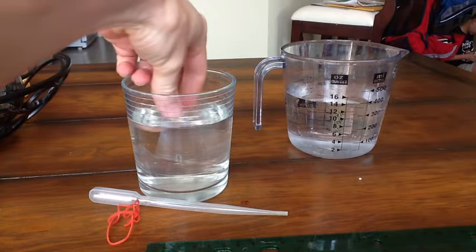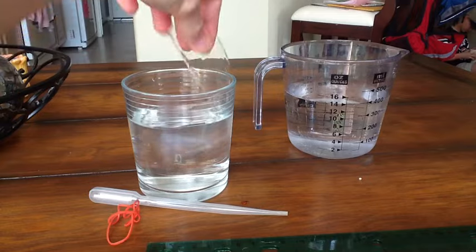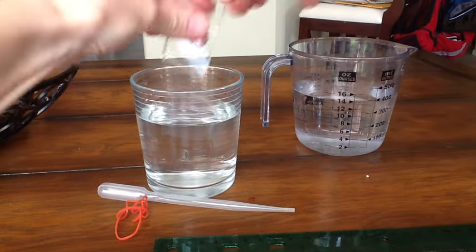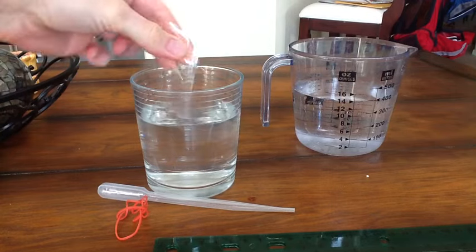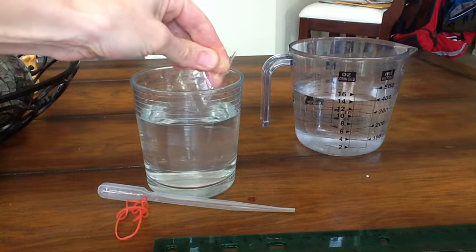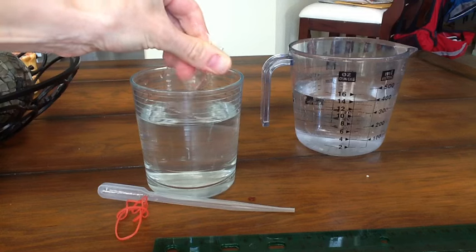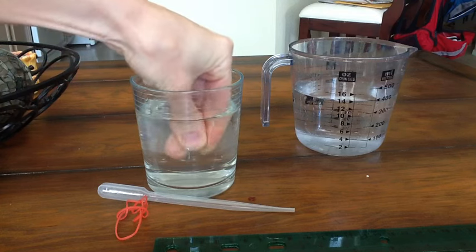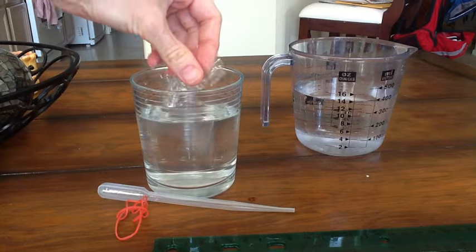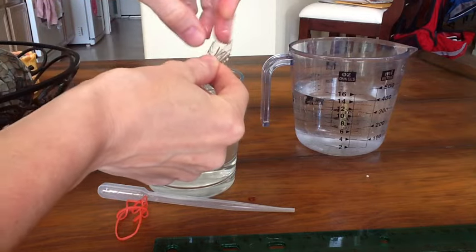Okay, it's been two to three minutes later and you're just going to reach in to your water bath that you put the dialysis tubing in. And what we need to do is we need to hold this between our thumb and our forefinger and just kind of rub it back and forth. A lot of times it helps if you do this in the water. And as you rub it back and forth what's going to happen is this tubing is actually going to open up and separate.